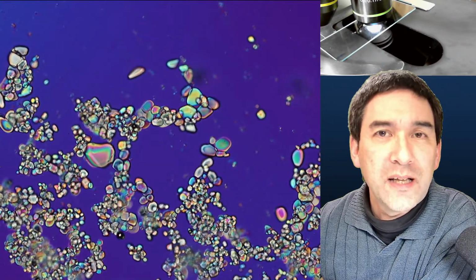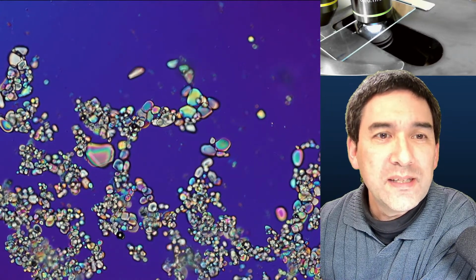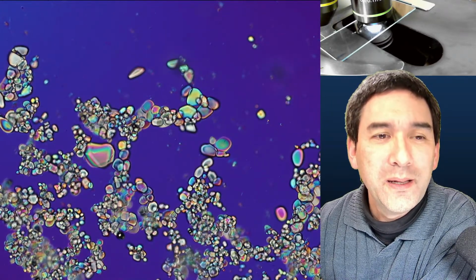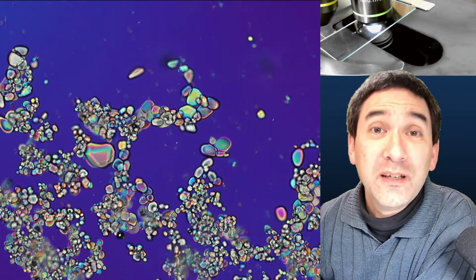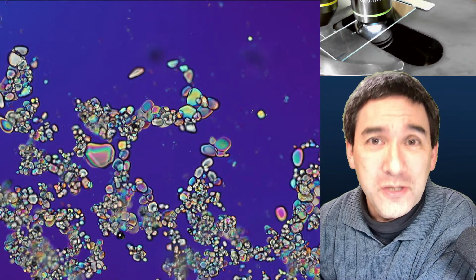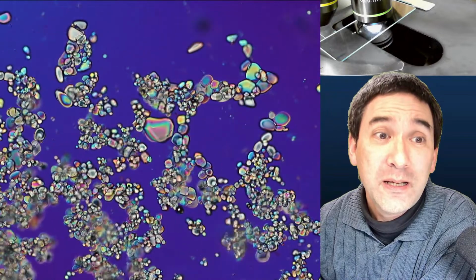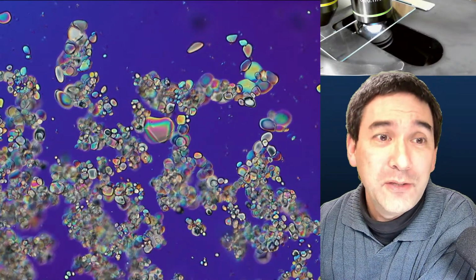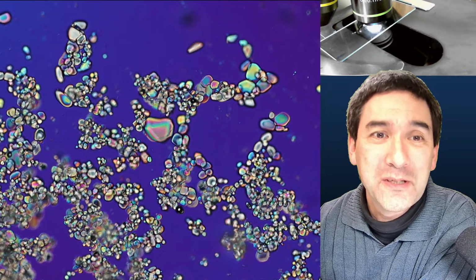because it started to crystallize. But then I think the moisture from the air got attracted to the extent that the crystal started to melt again and started to round off. So it was kind of reverse crystallization. Basically, it's the moisture of the air that started to dissolve the crystals again, right? Something that's quite a fascinating thing, and this actually now motivates me to maybe get some kind of a hot plate or something to speed up the crystallization process.